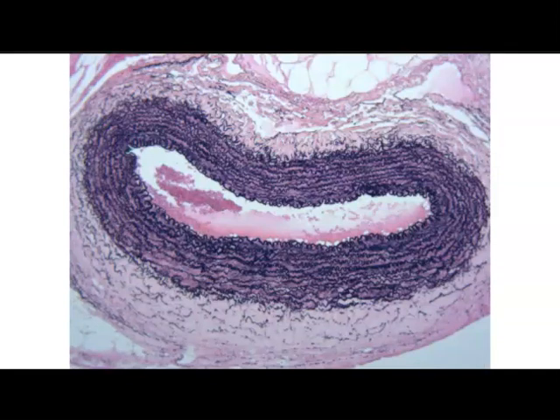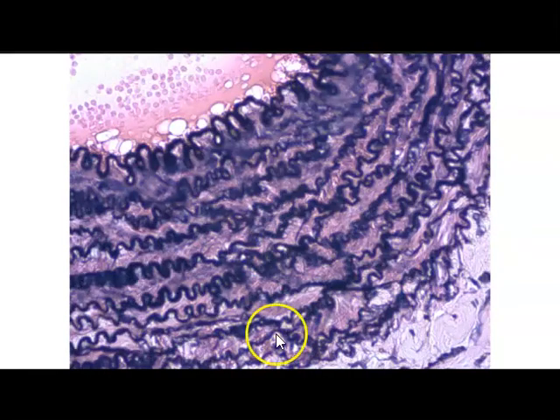So this next slide is showing elastic connective tissue, specifically within the walls of major blood vessels. This is an artery, and we can see these dark fibers, which are the elastic fibers here, elastic connective tissue represented in this slide. Again, more of these beautiful elastic fibers or elastin fibers that make up the elastic connective tissue within, this is specifically the tunica media of a major blood vessel, probably an artery. And more of that elastic connective tissue or elastic fibers.